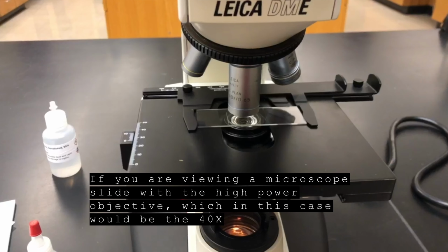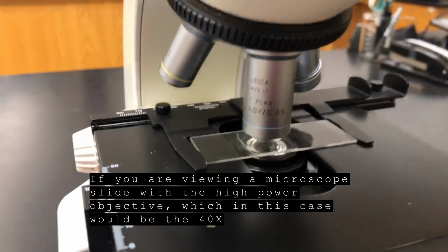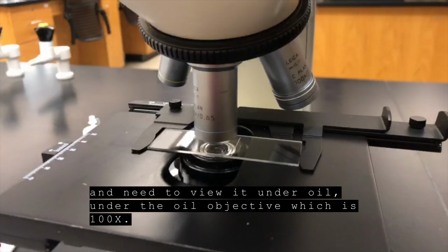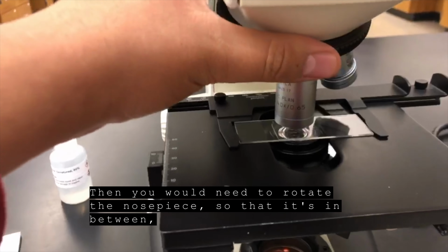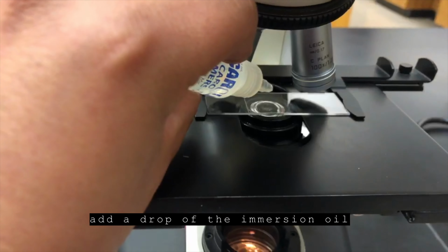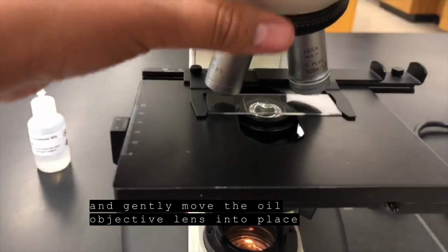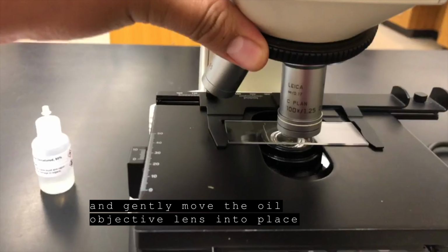If you are viewing a microscope slide with the high power objective, which in this case would be the 40x, and need to view it under the oil objective, which is 100x, then you would need to rotate the nose piece so that it's in between, add a drop of the immersion oil, and gently move the oil objective lens into place.